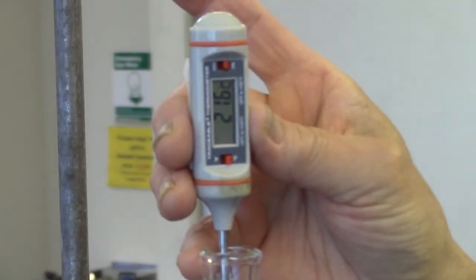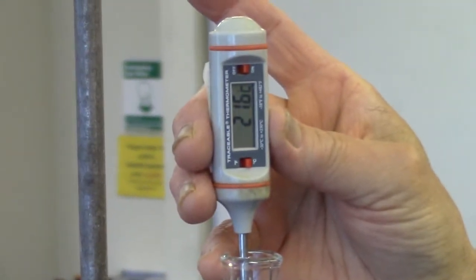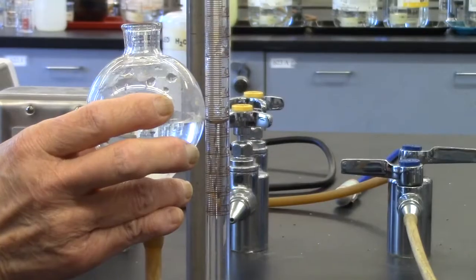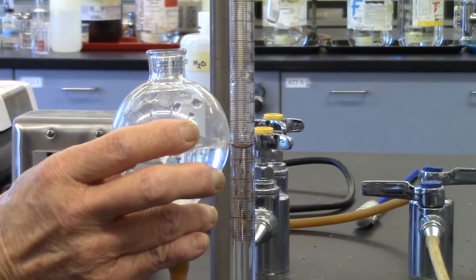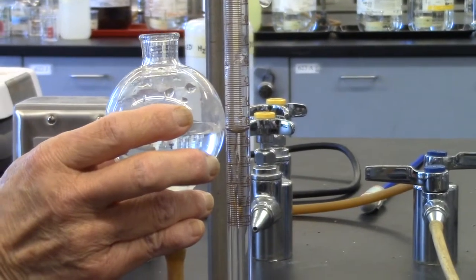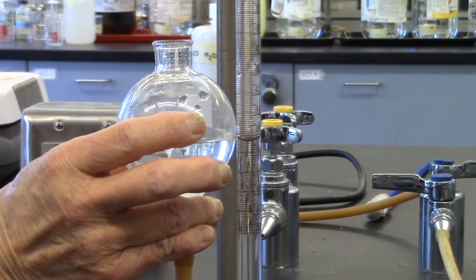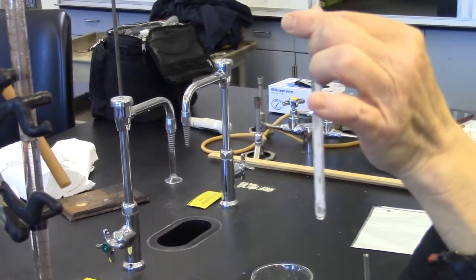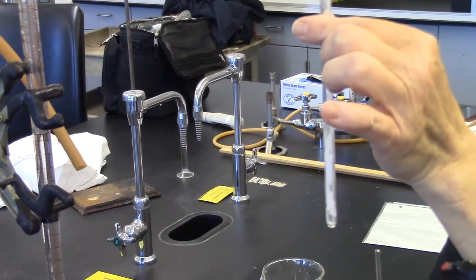While waiting for the reaction tube to cool, take temperature of water and record. Once cooled, take final volume manometer reading by aligning water level in manometer with the water level in the leveling bulb and record this reading. Remove the reaction tube and weigh it on an analytical balance. Record this weight.